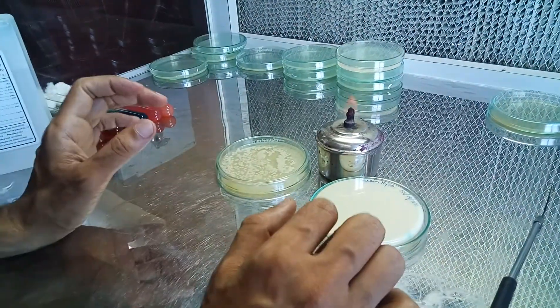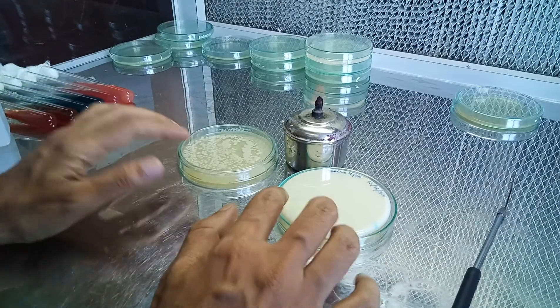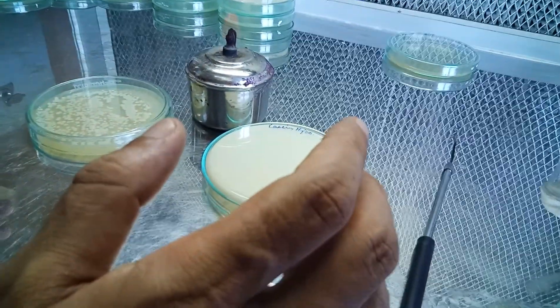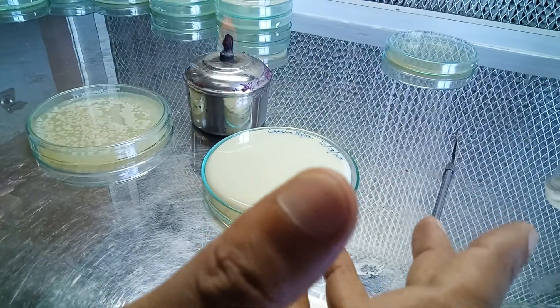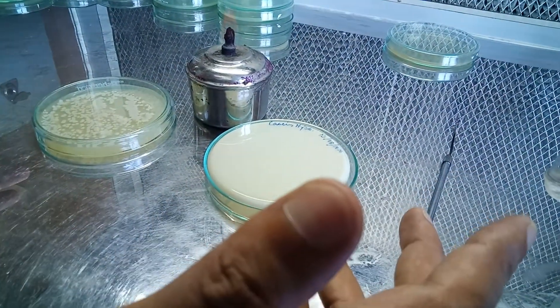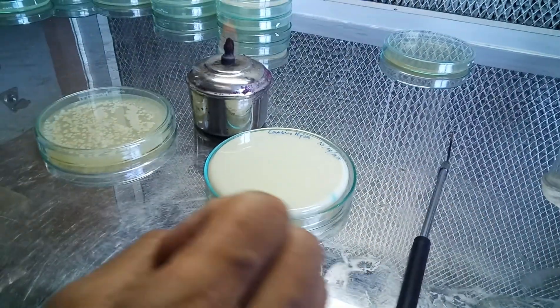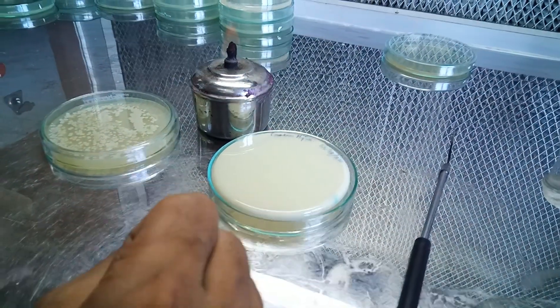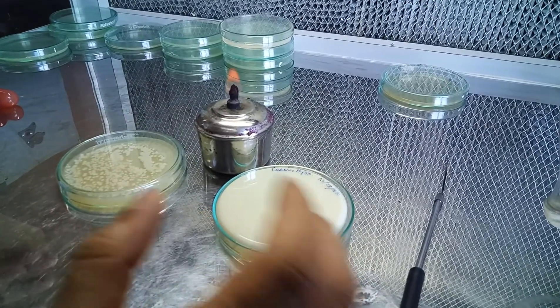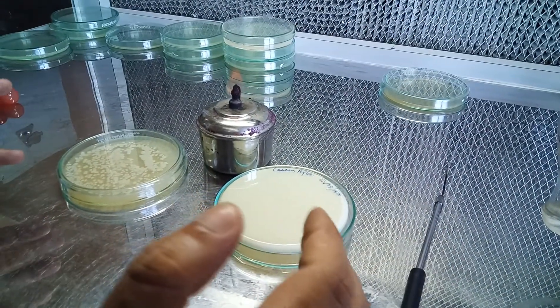Casein is a protein, and there are certain bacteria capable of breaking it down — such as Streptococcus, Staphylococcus, Bacillus, Clostridium found in soil, and Pseudomonas. These bacteria are capable of producing extracellular enzymes, specifically a type of protease called caseinase, which can break down casein.